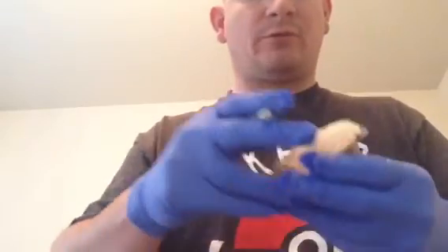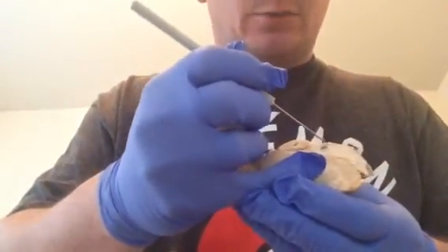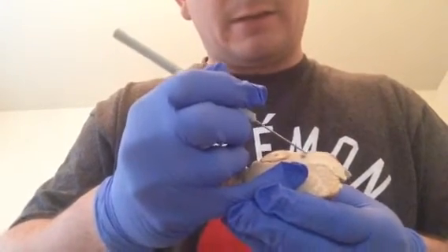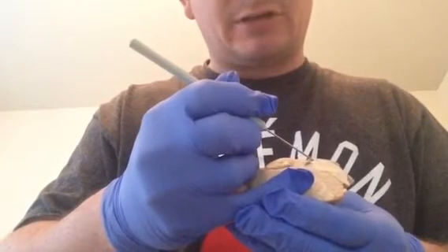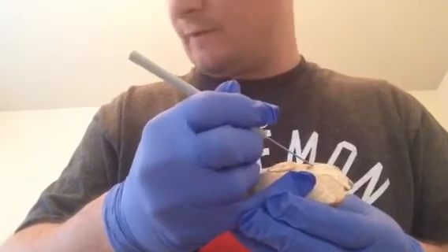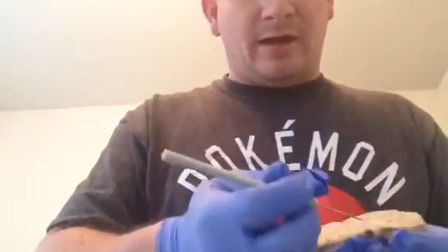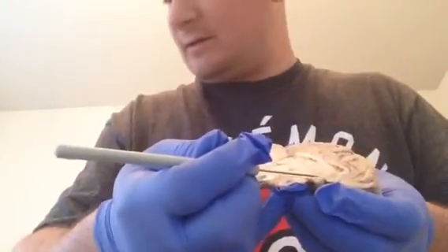The meninges or dura mater I thought would be a little more prominent if we actually removed the brain from the skull itself, but I did find a decent example where I could separate the dura mater being the top layer, the arachnoid layer being this middle section here, which is a little more like the spinal tissue itself, and then the pia mater below that. And below here we have our pituitary, or what I think is the pituitary gland, right here.